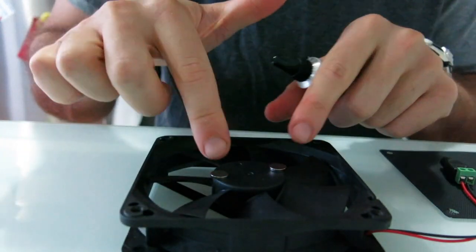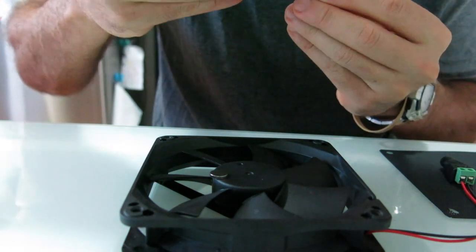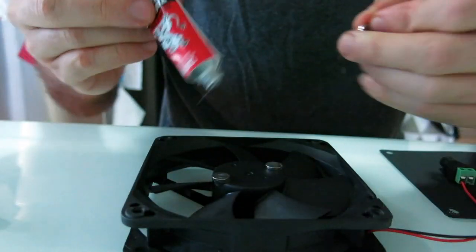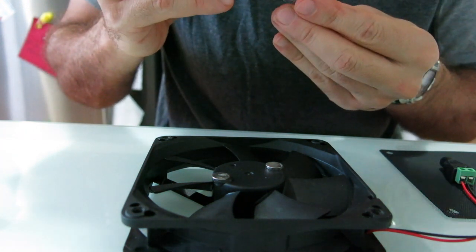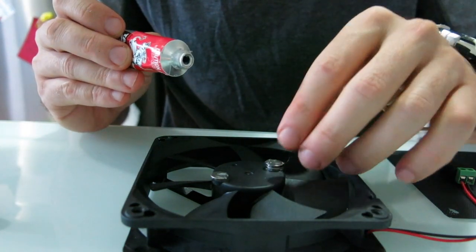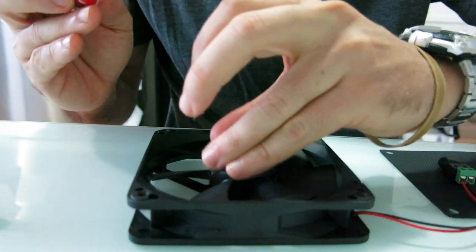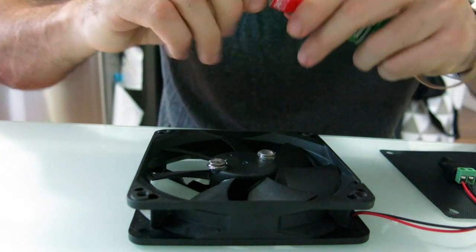The trick is to find where they stick to the outside. You can use any glue you like, but Tarzan's grip has never let me down. And I'm gluing two together because the fan turns at quite a speed and it might actually spin it off if I don't glue both to each other. They're quite powerful.